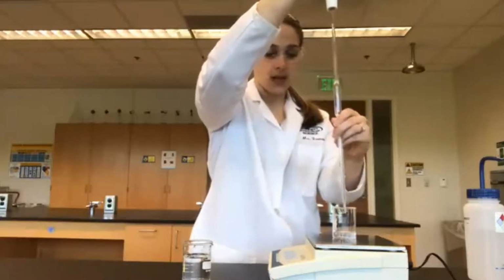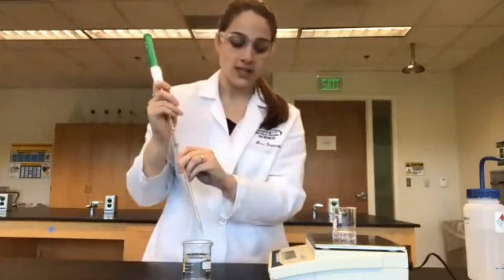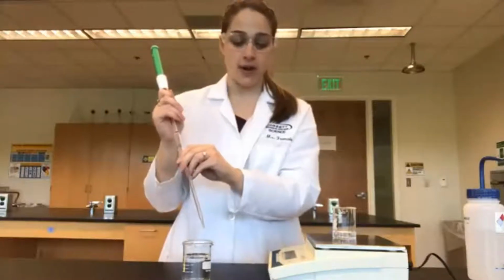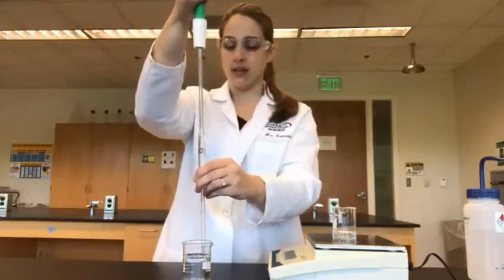All right. And our mass is 38.47 grams after adding in 10 milliliters of water. Let's add in our second 10.